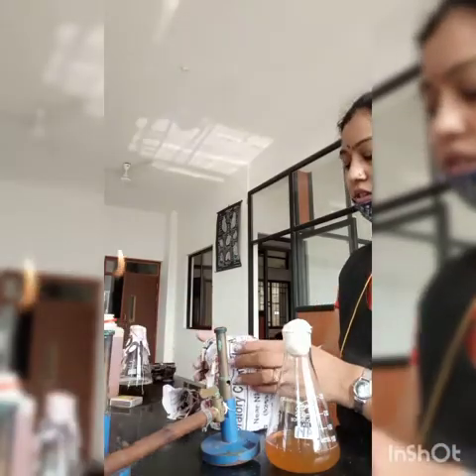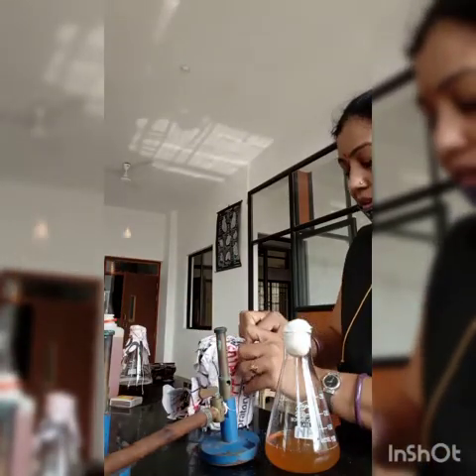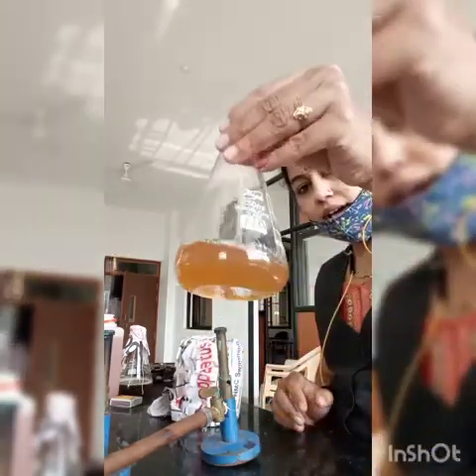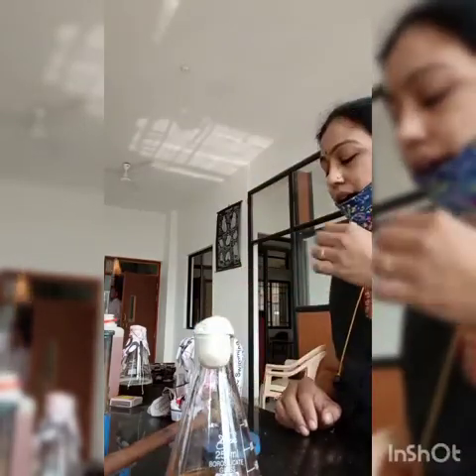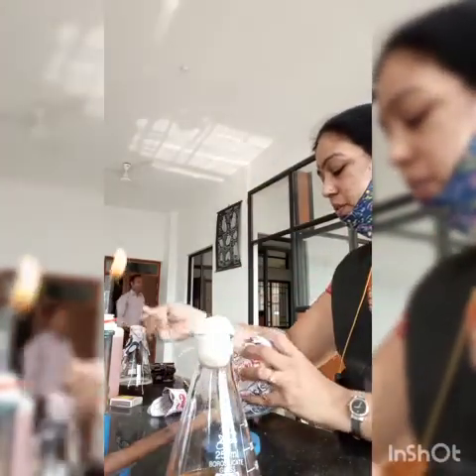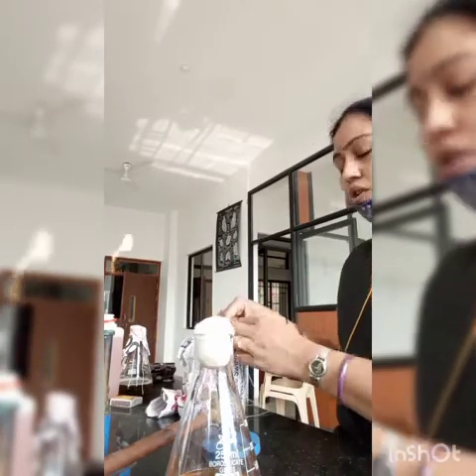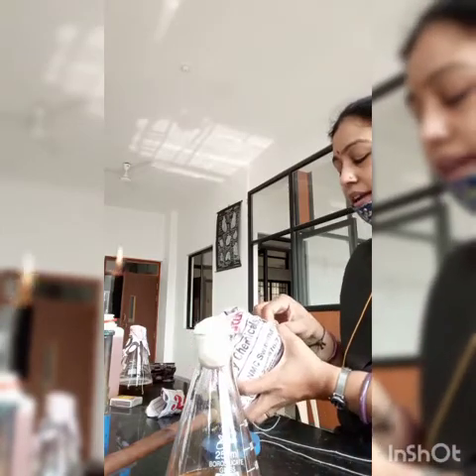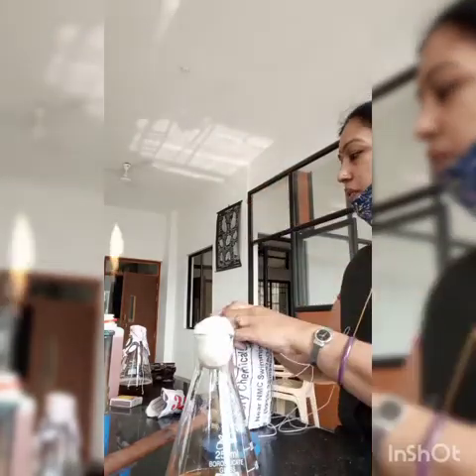So students, for subculturing of the bacteria or fungi, I prepared this nutrient agar. I told you the composition of nutrient agar. So I added all the ingredients in the nutrient agar, and then I sterilized all the material, that is media, as well as these petri plates, along with the test tubes.